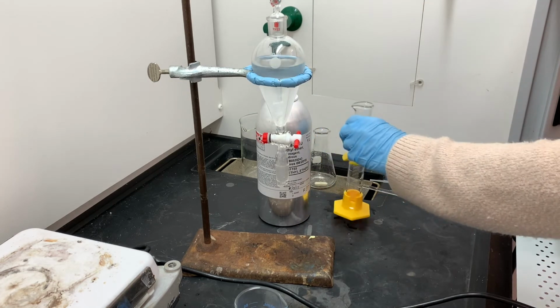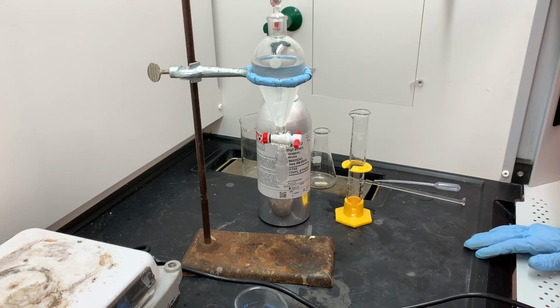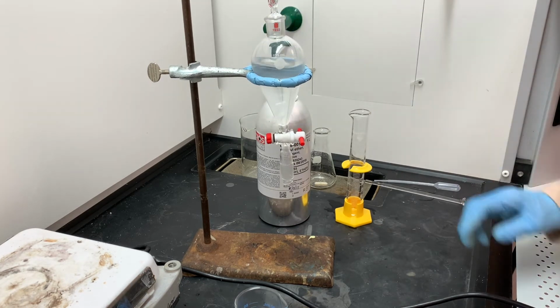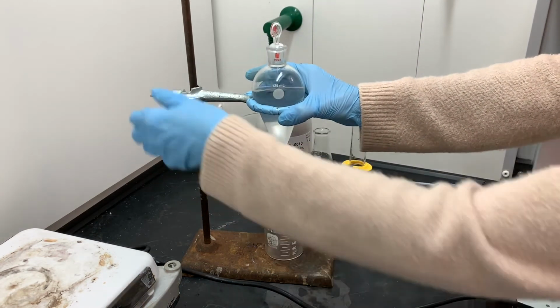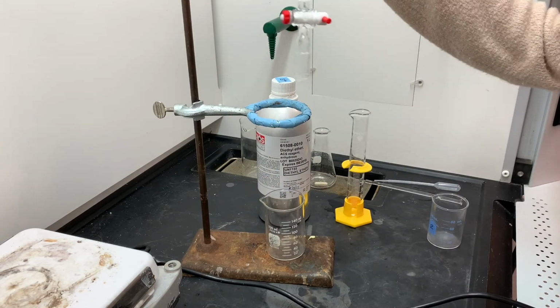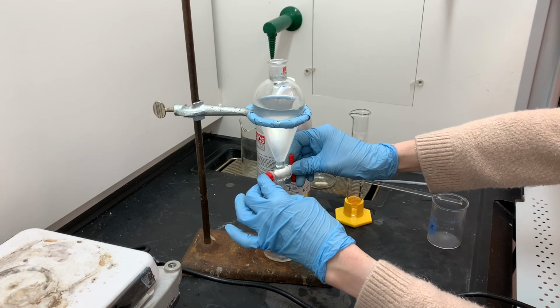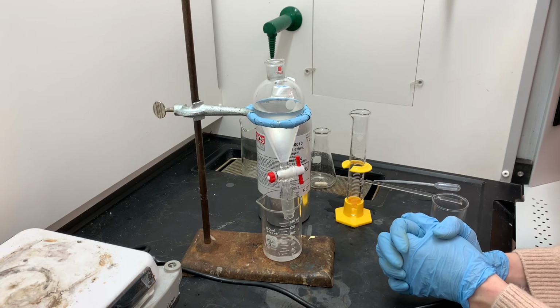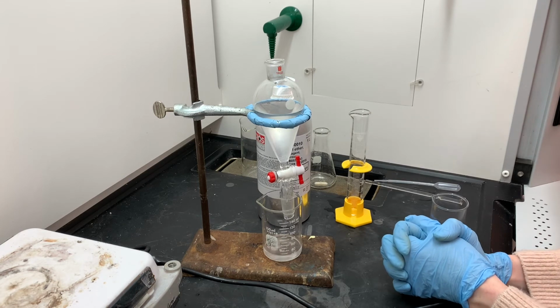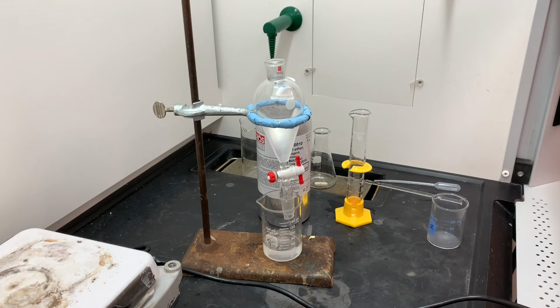And then once that layer is clear, I'm going to drain out and separate these two different layers. Now, if you recall, the strategy here is to drain the aqueous layer. The aqueous layer is the big layer that's down on the bottom. So I'm going to drain out the aqueous layer. And ultimately, I'm going to be putting that aqueous layer back into the separatory funnel to do another extraction, just in case any of the product was left behind in the aqueous layer. I'm going to repeat this whole entire process to try to get all of the product out of the aqueous layer. So right now I'm draining out the aqueous layer into this beaker.